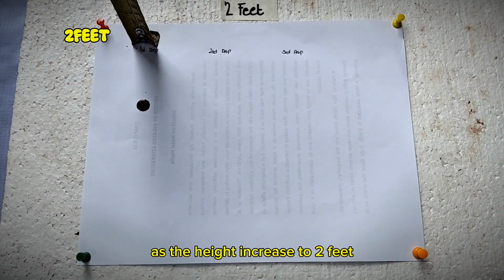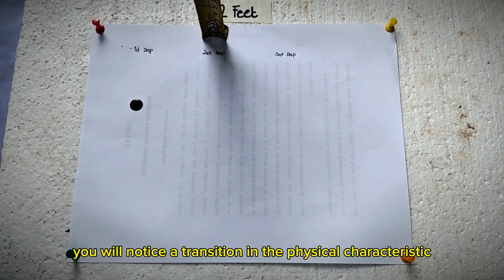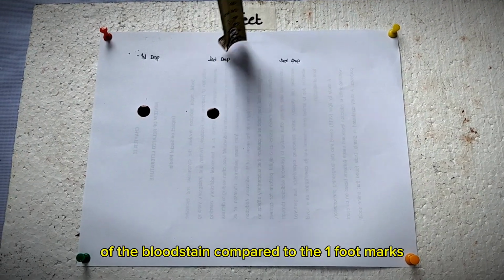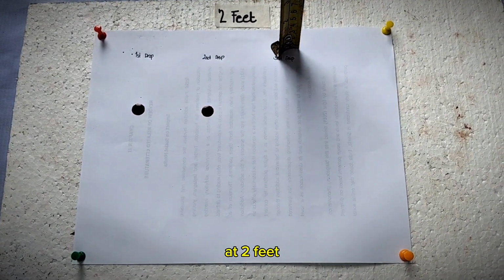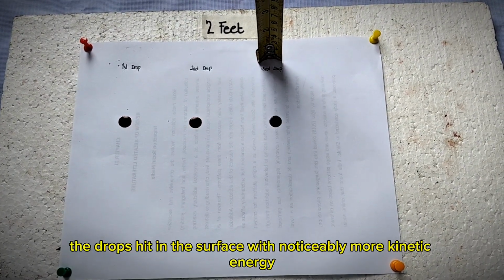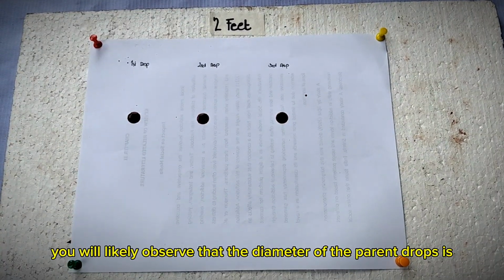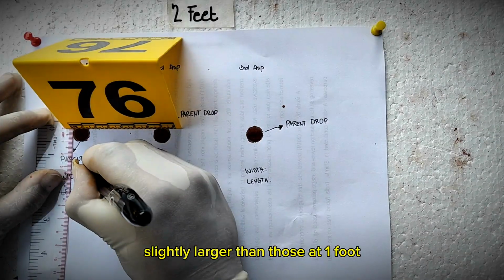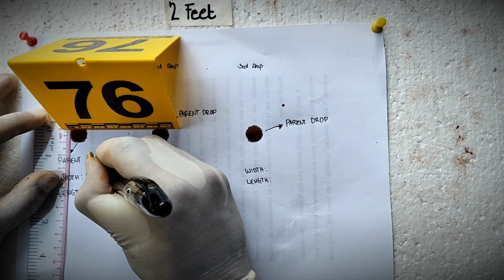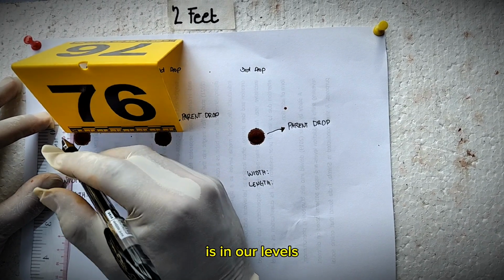As the height increases to 2 feet, you will notice a transition in the physical characteristics of the bloodstain compared to the 1 foot marks. At 2 feet, the drops hit the surface with noticeably more kinetic energy. You will likely observe that the diameter of the parent drops is slightly larger than those at 1 foot, at around 1.1 cm to 1.2 cm based on our measurements.